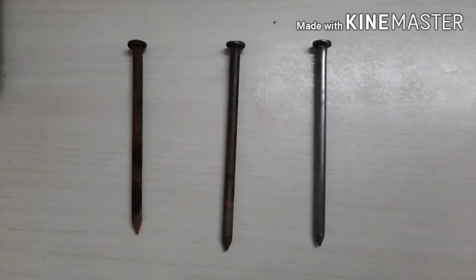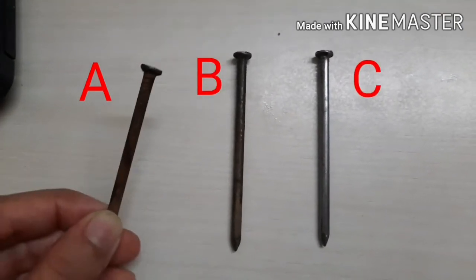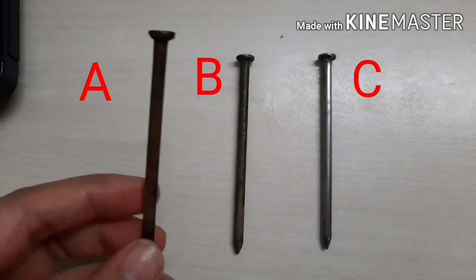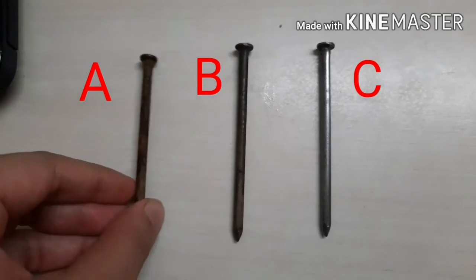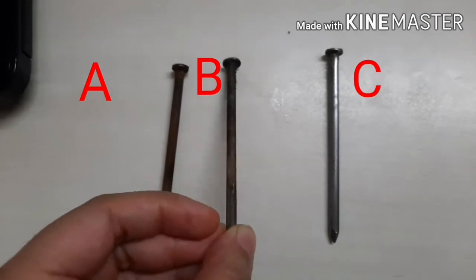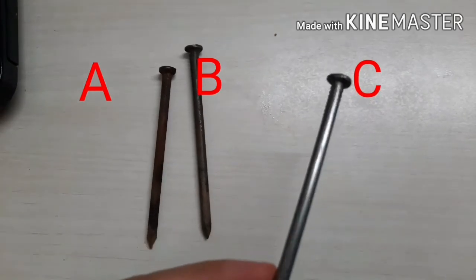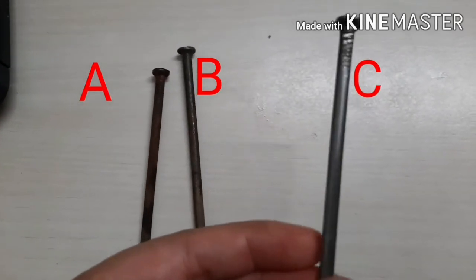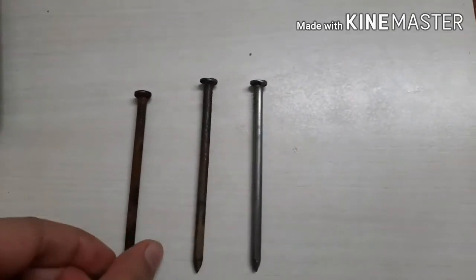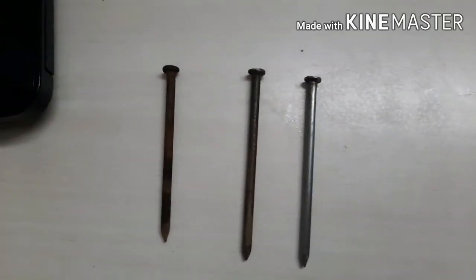Okay children, so now I have taken out the iron nail from each cup after 1 week. So this is the iron nail which I have taken out from cup A. And I can see that it has changed after 1 week. And this is the iron nail which I have taken out from cup B. It has also changed. But children, this is the iron nail from cup C, and what I can see is that nothing has happened to it. It has not changed. Okay, so these are the observations of the iron nail after 1 week of the experiment.